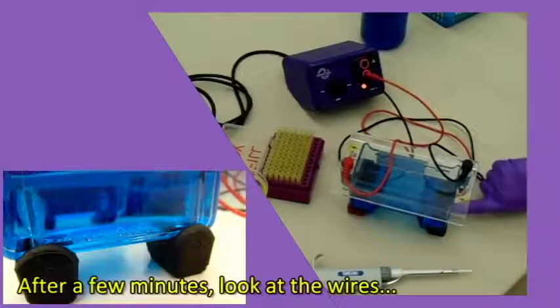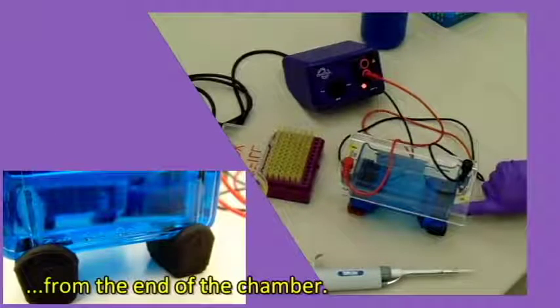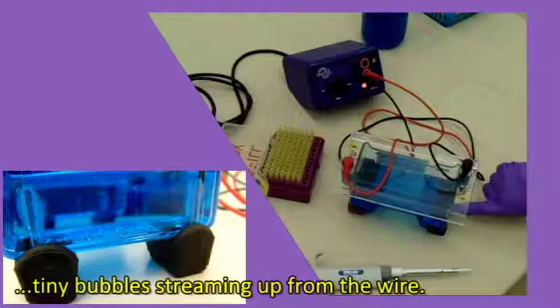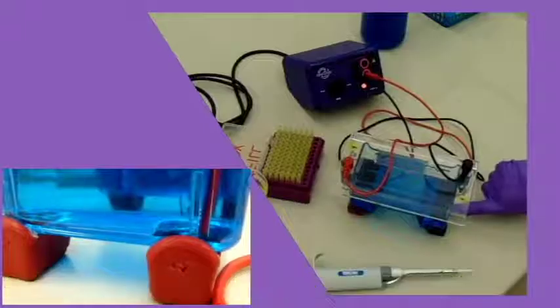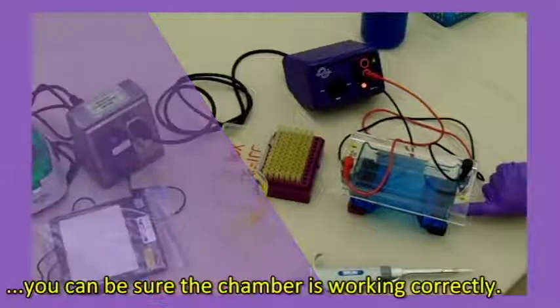After a few minutes, look at the wires from the end of the chamber. You should be able to see tiny bubbles streaming up from the wire. As long as at least one of the wires has tiny bubbles, you can be sure that the chamber is working correctly.